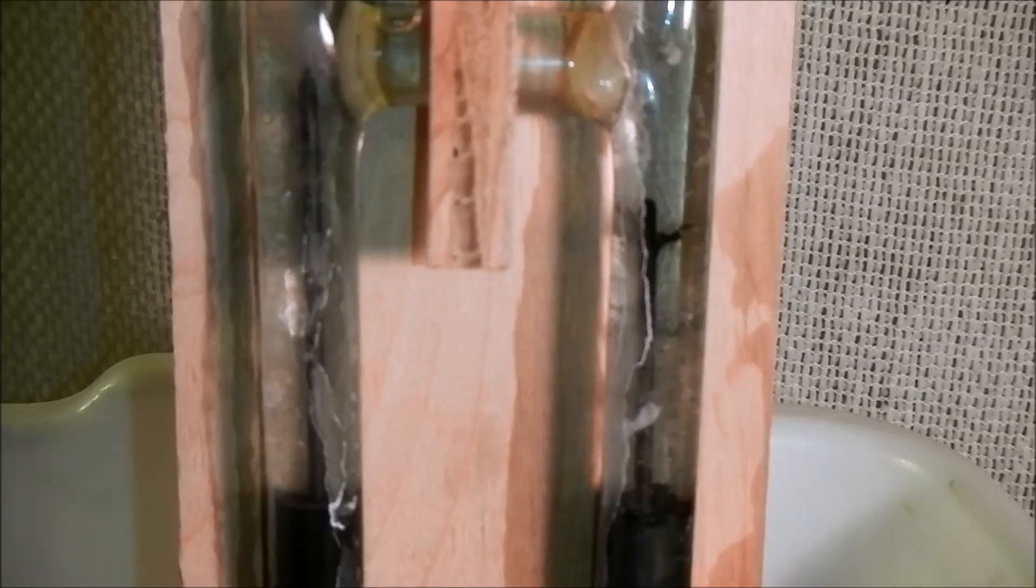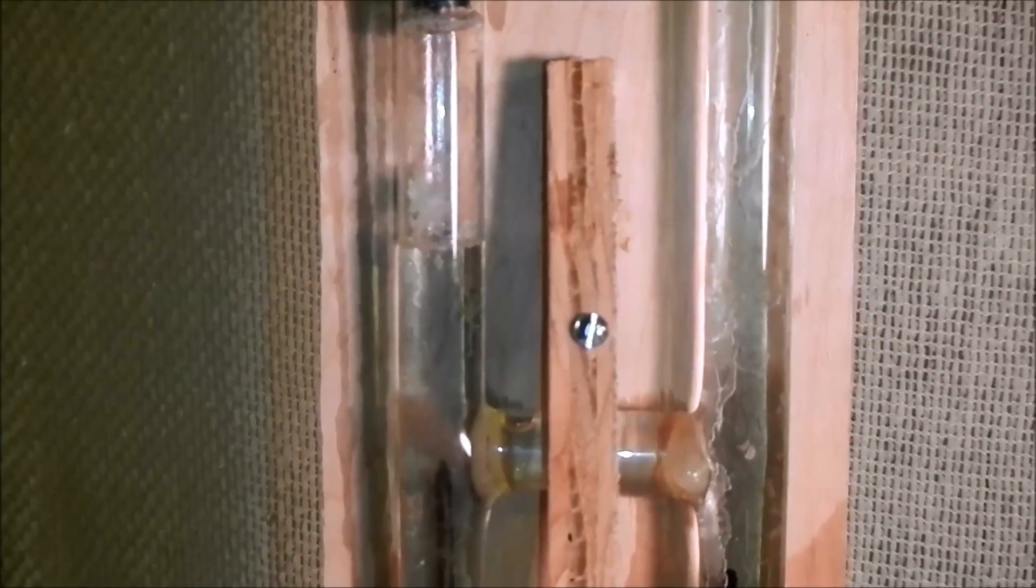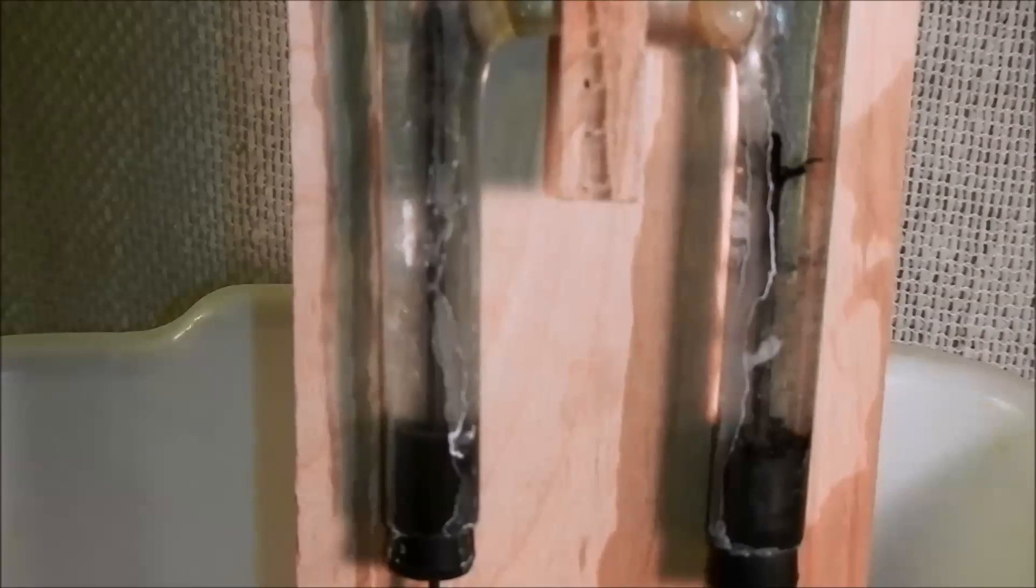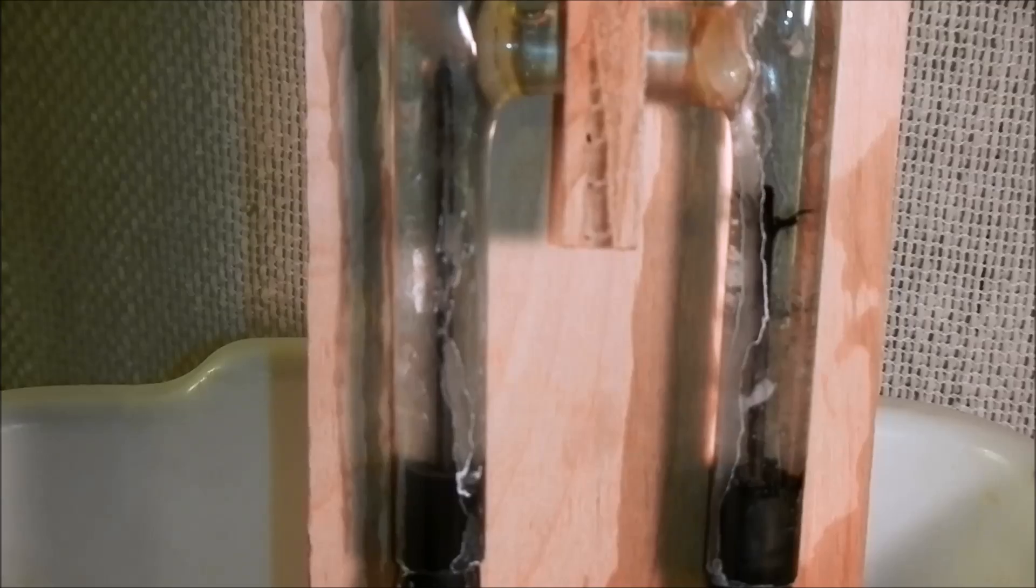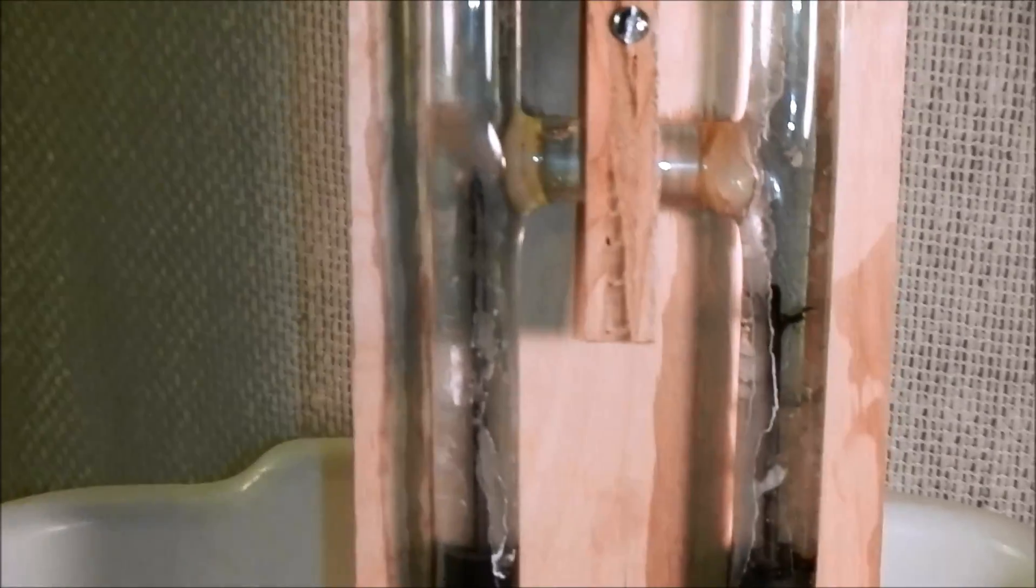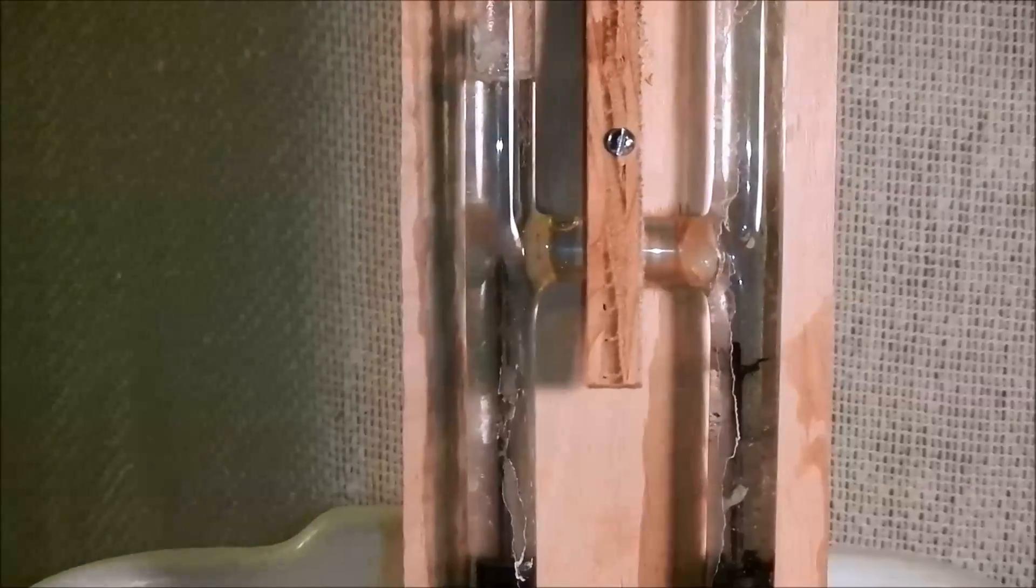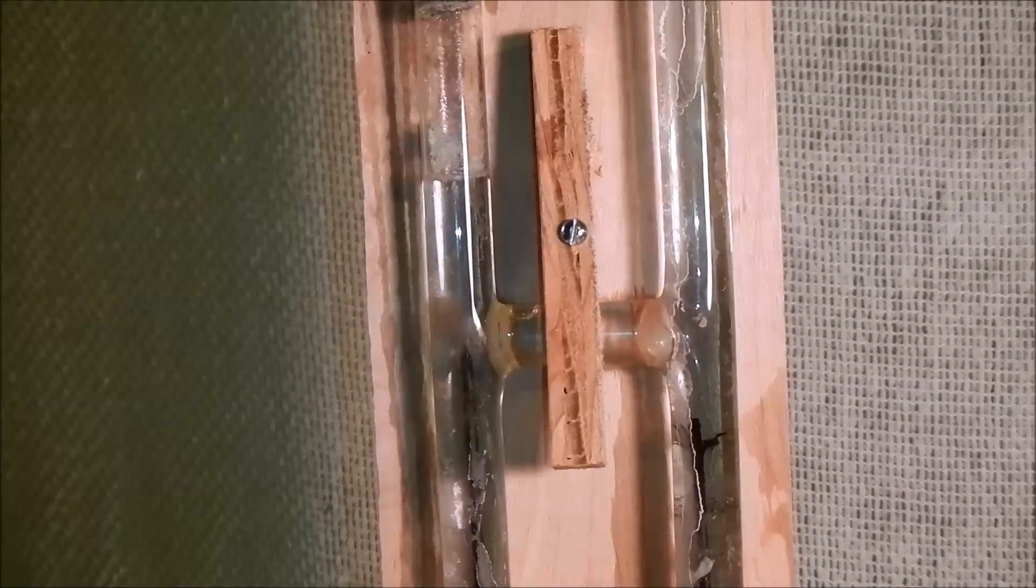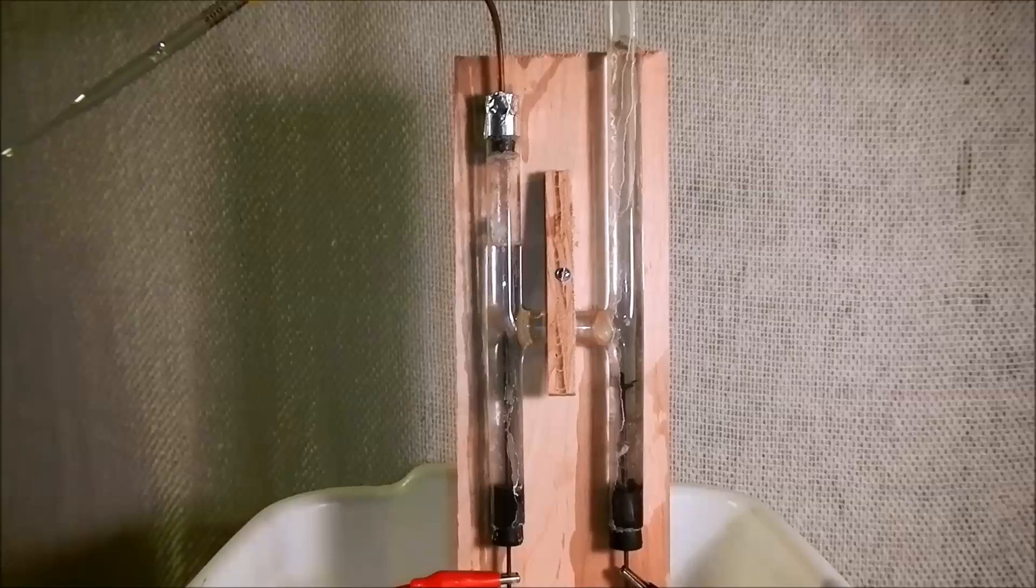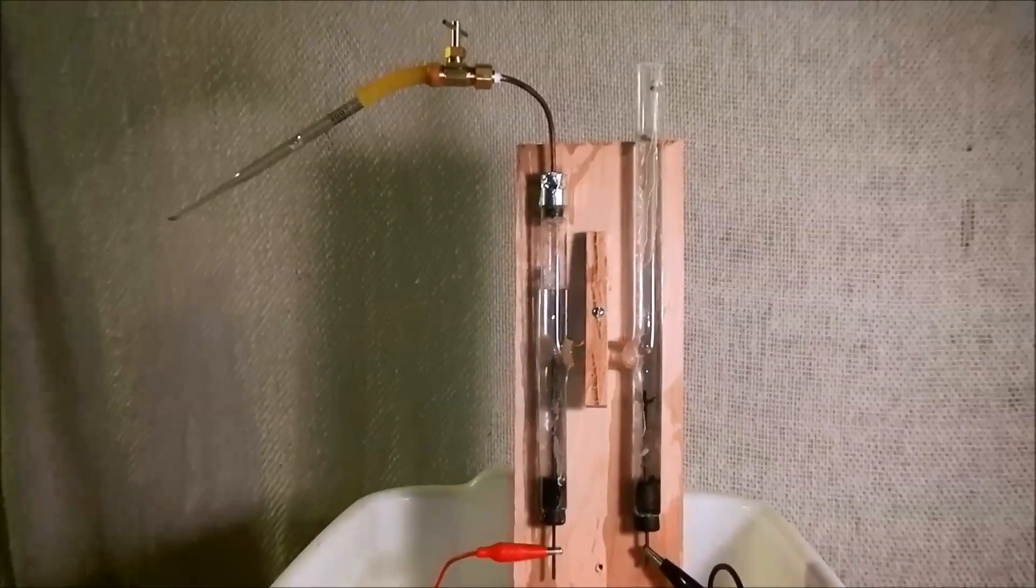And so I'll power it on and demonstrate. Also, the water doesn't become very tainted and tarnished. If you might use salts and steel plates, it'll become very dark water and very cruddy. But the water with baking soda and the carbon pencil lead graphite electrodes keeps the water nice and clean and clear, so you can always see what's going on with the reaction.